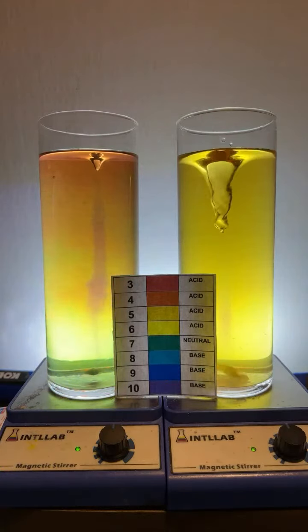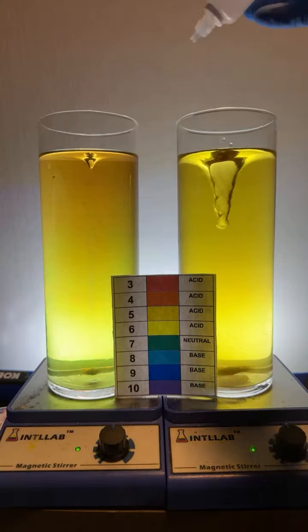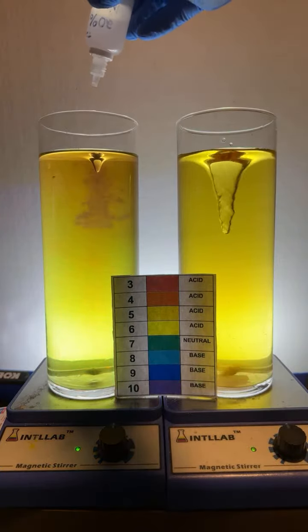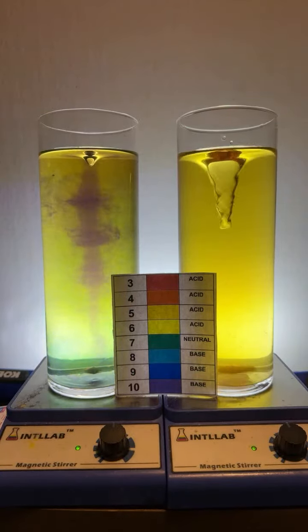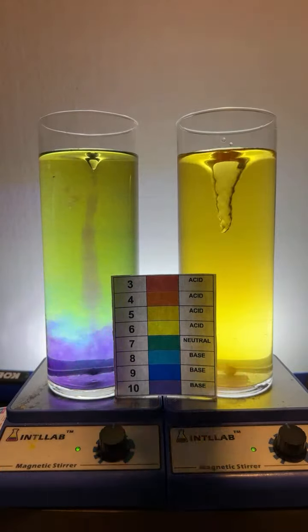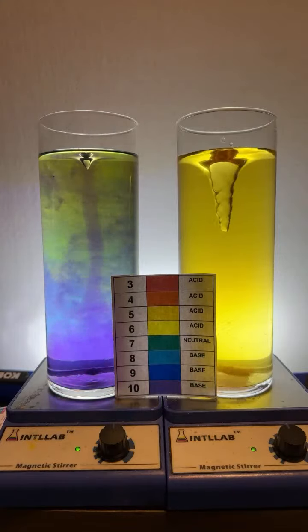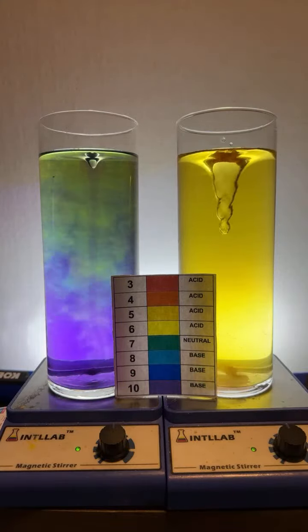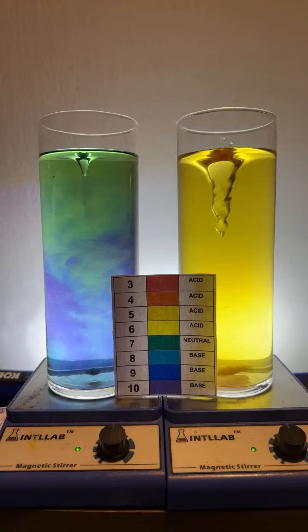Now deep blue is tough to get. Put Listerine in it. Hello there, Snowball. Deep blue is tough to get. Violet's easy, but deep blue is tough to get. We're going to give it a shot here. We're going to try to get to blue, because I think that's going to go to violet over there. Come on, maybe I'm going to get it to blue. Let's see what happens. It is like a tornado.